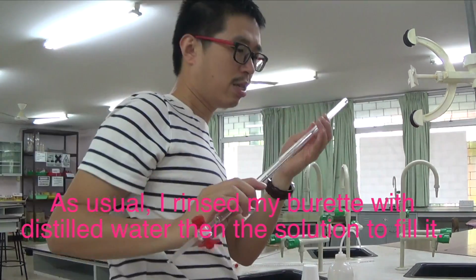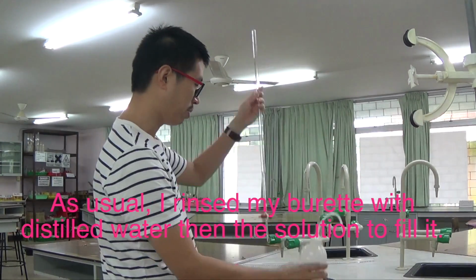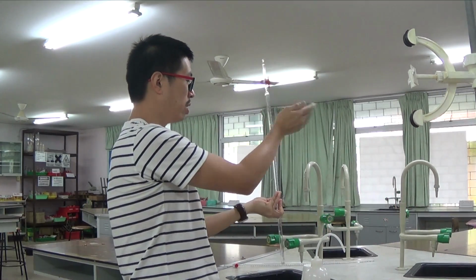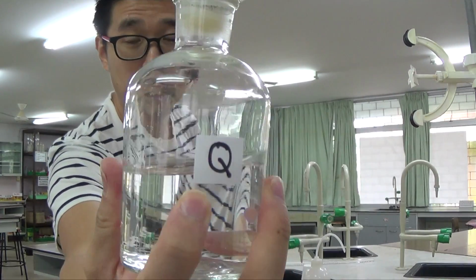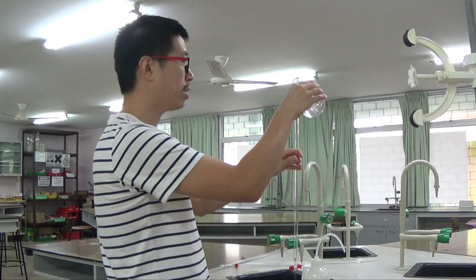Before you use a burette, I typically always wash the burette with a little bit of distilled water. Make sure you wash the bottom as well, and then roll it out and remove all the distilled water. But just like the pipette, you also have to rinse it with the solution that you're going to fill it in here. I will have Q in the burette, so I put a little bit of Q in here, just a little bit for washing.